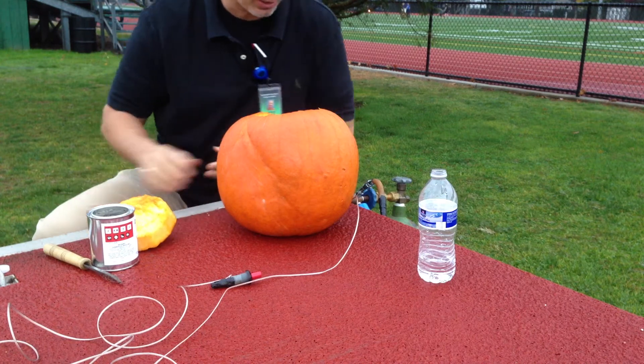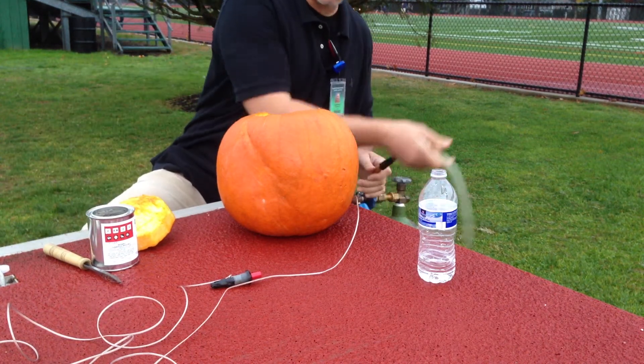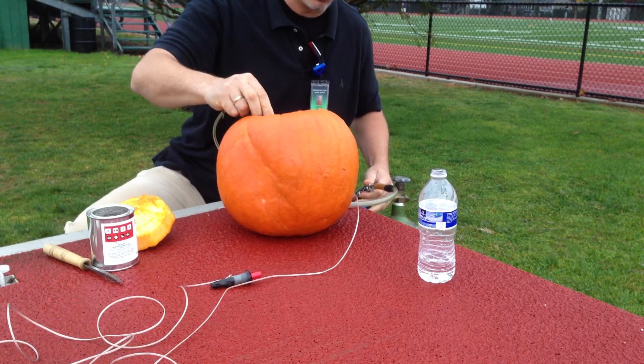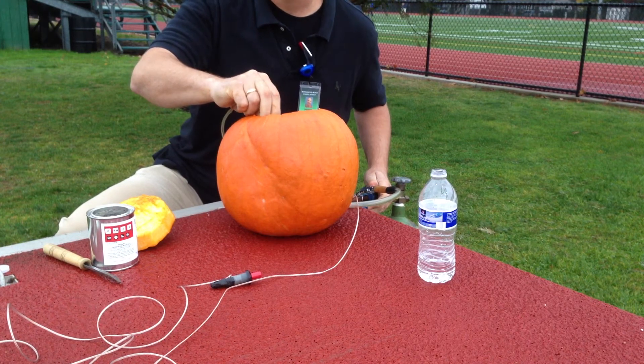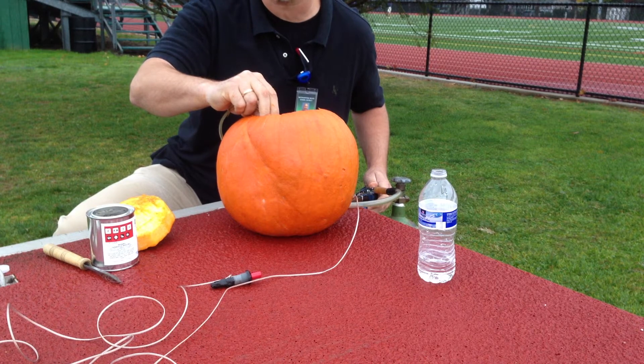What I'm going to do is put some oxygen gas in here. Usually air is about 20% oxygen, but I'm trying to increase the odds by having more oxygen in here. I'm pumping this up with a lot of oxygen, making sure that I have a correct stoichiometric ratio with acetylene to oxygen — otherwise I'm just guessing.